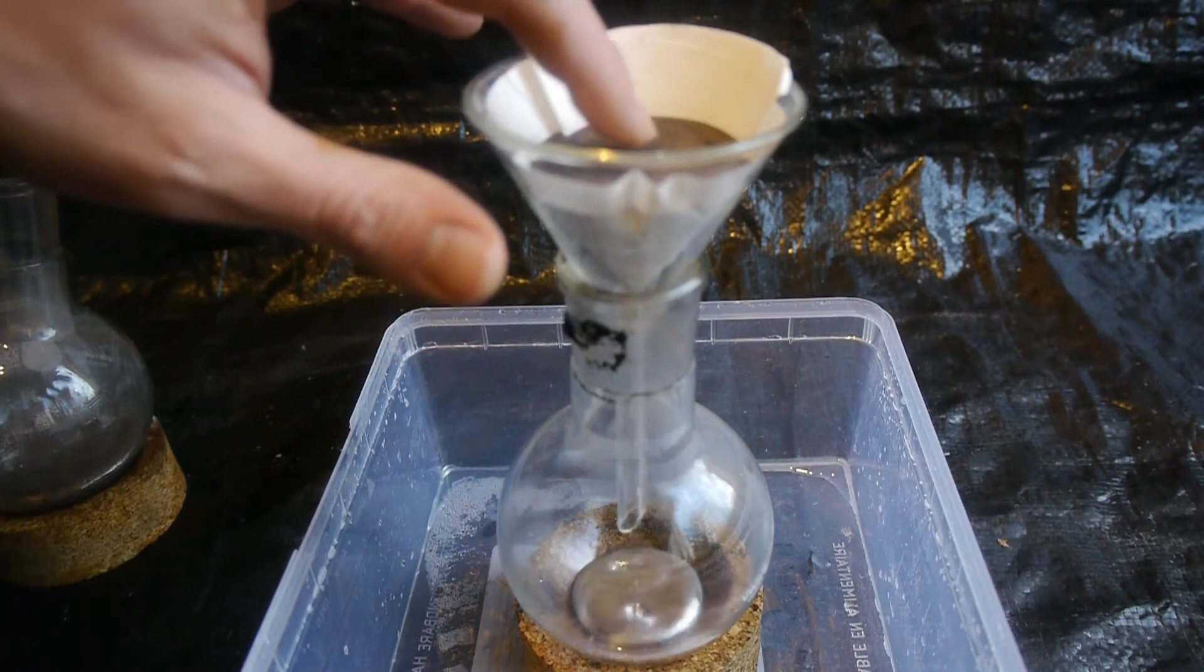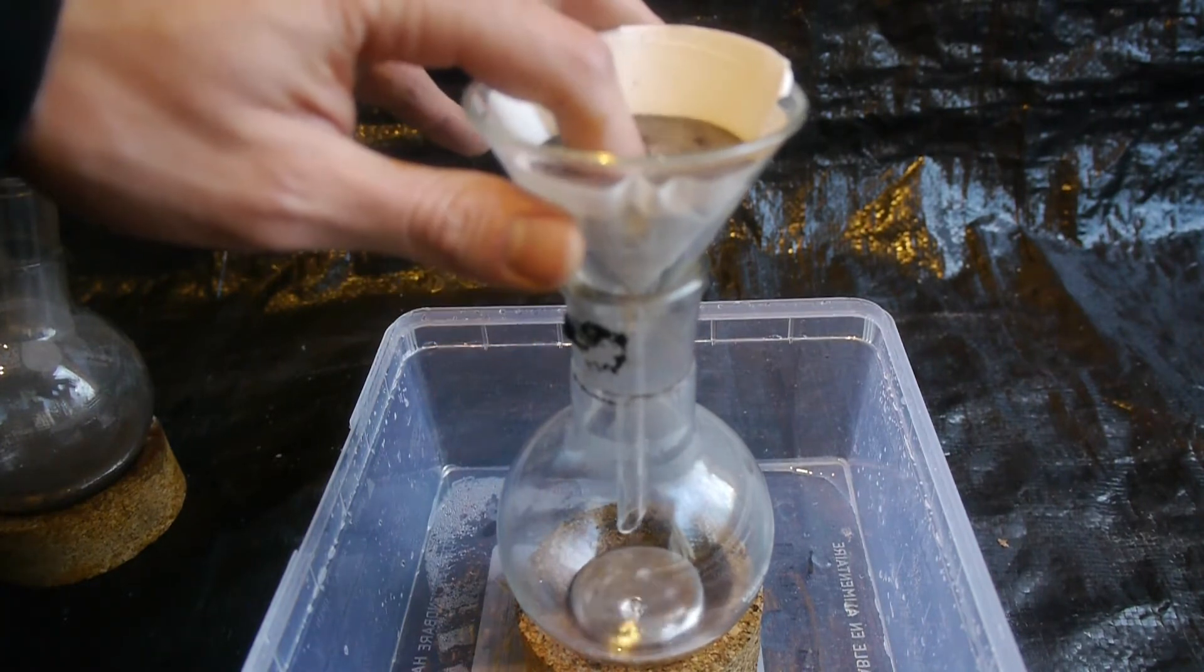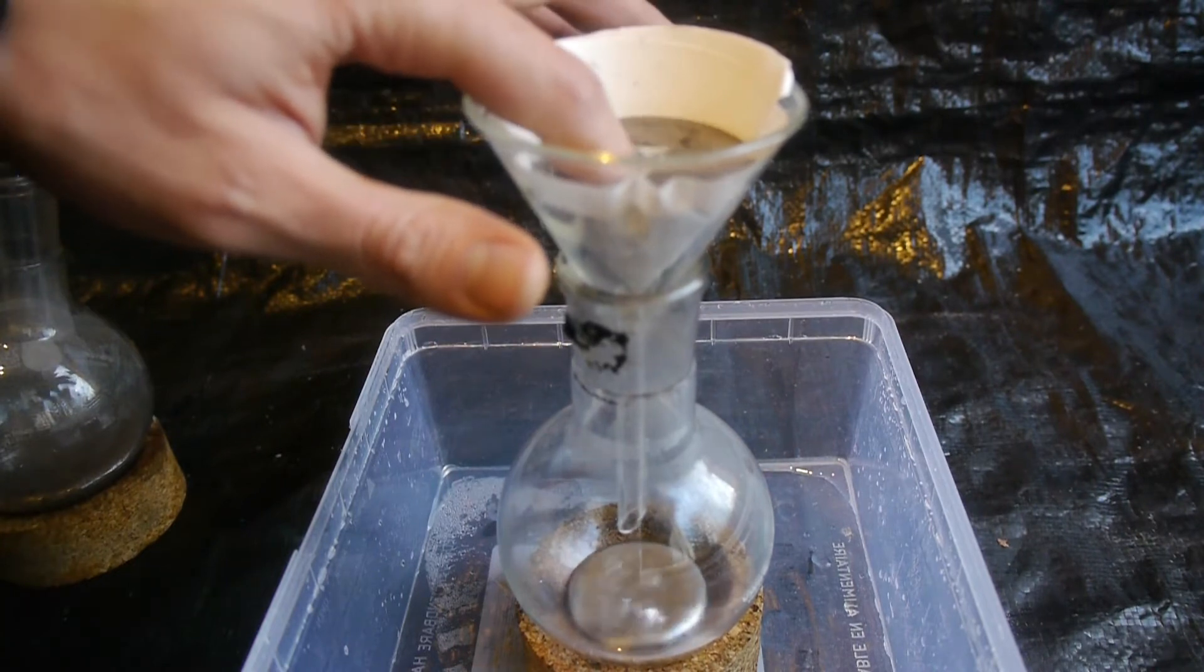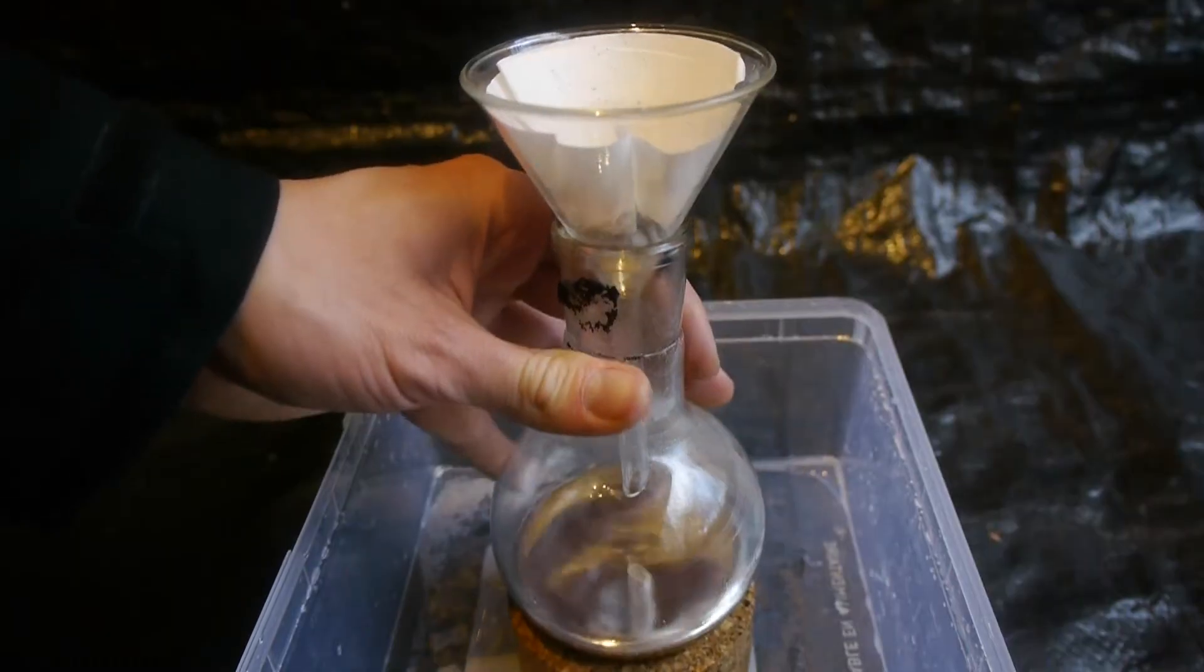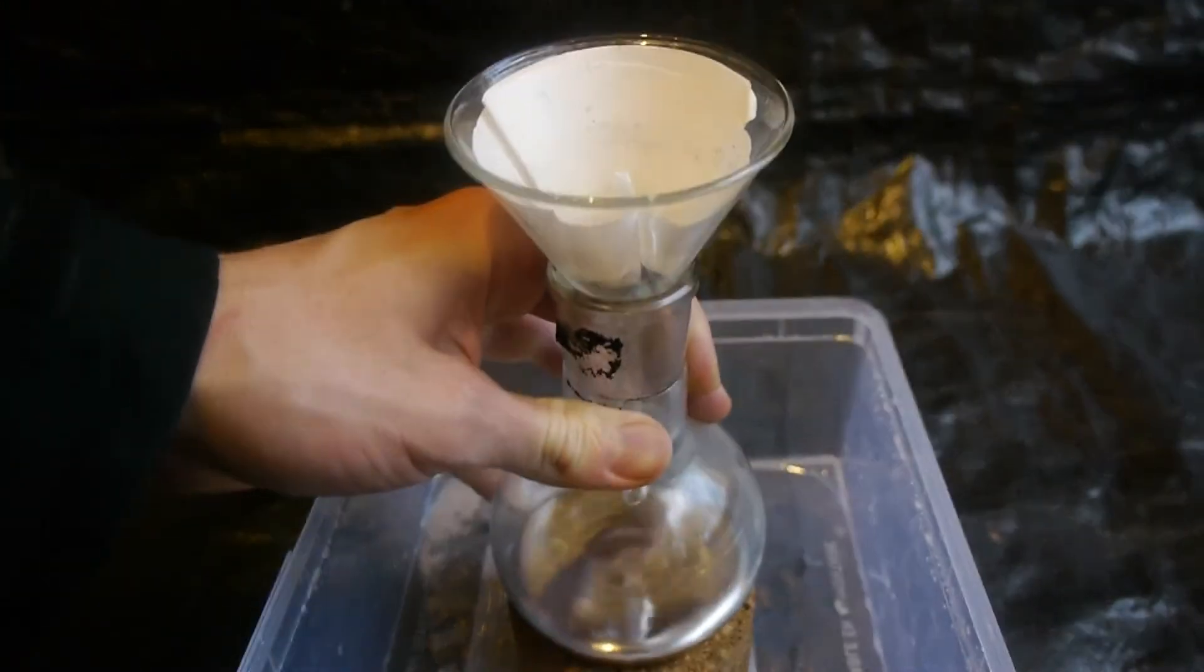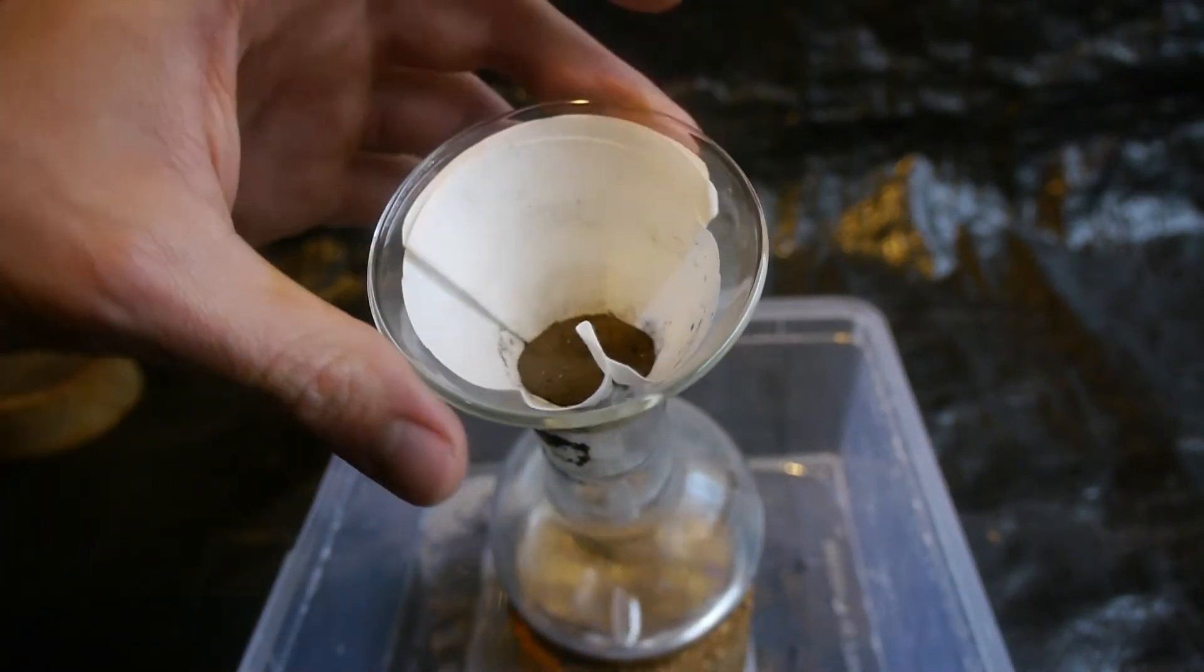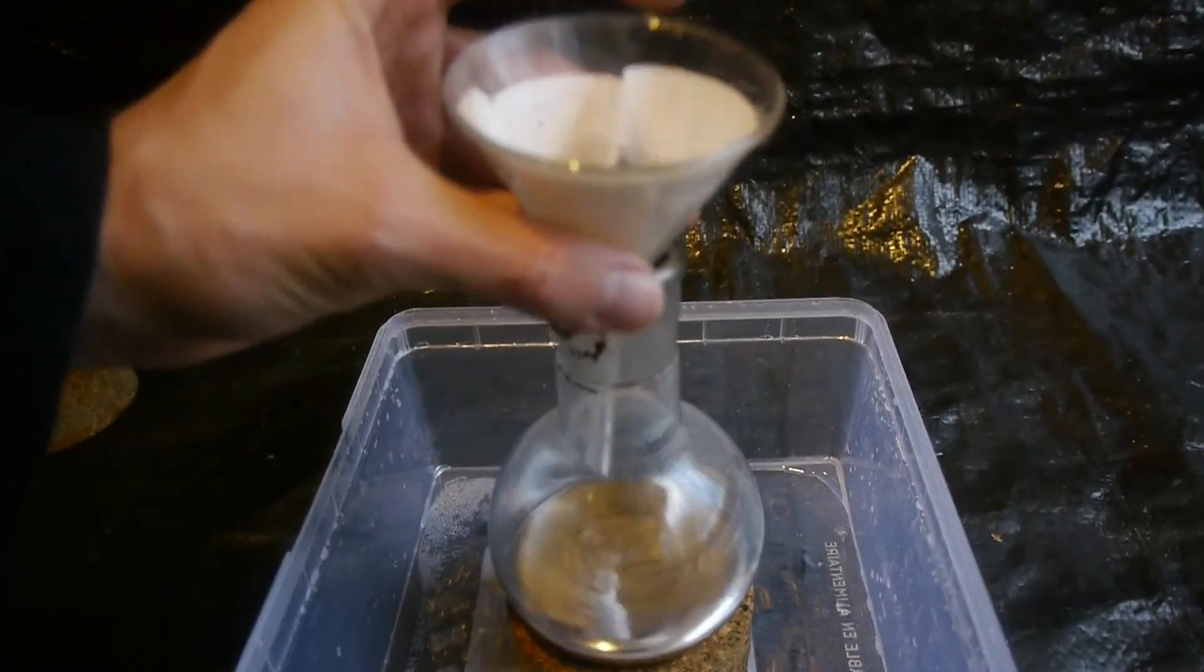Let's remove the remaining water from the surface. Kind of want to stick my finger in there. Oh my god. That feels incredibly amazing. It's unlike anything I have ever felt before. And very cold. Okay, so what went through the filter looks now very beautiful and shiny. But what didn't go through... I have no idea what that is about. But it's still quite a bit of mercury.